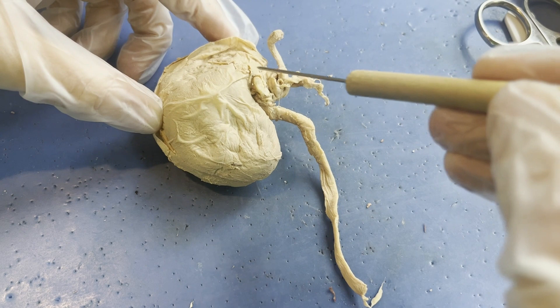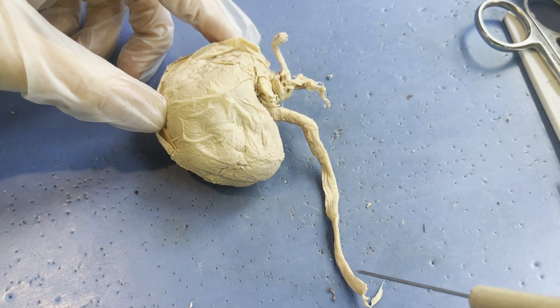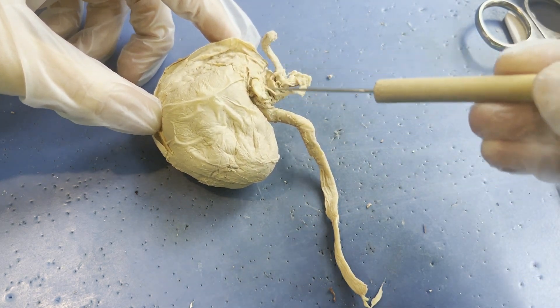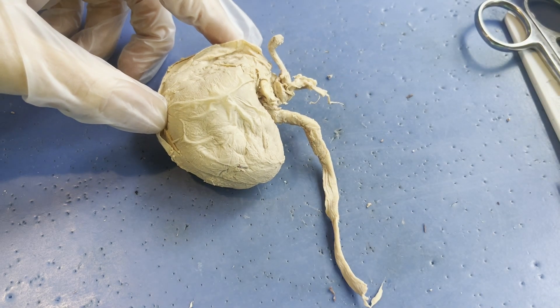So just to recap: renal hilum, ureter, and then in this bundle we've got a renal artery and a renal vein.